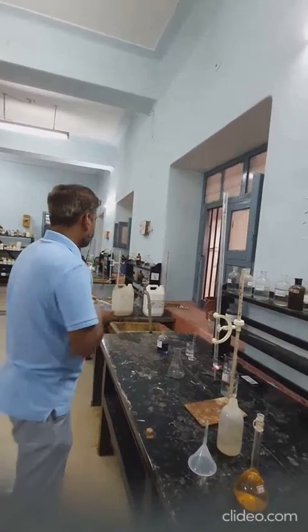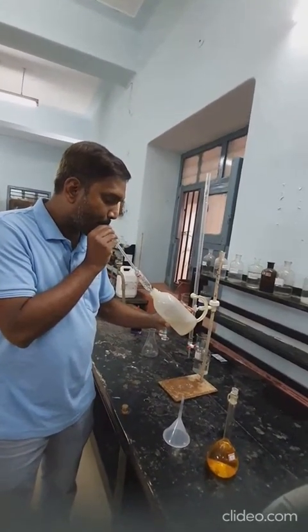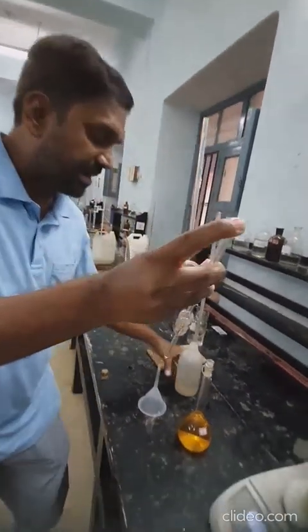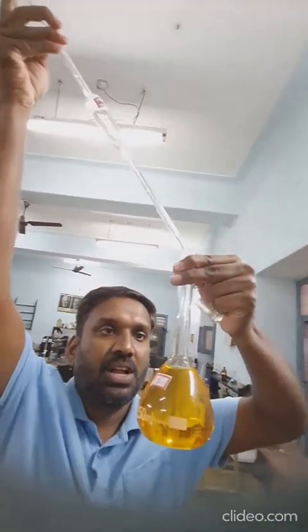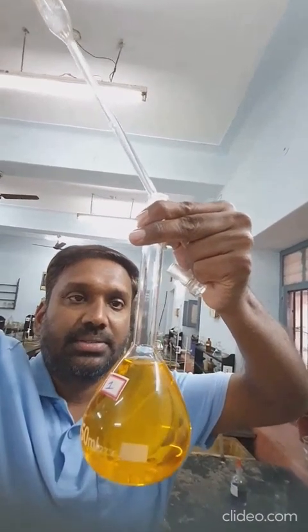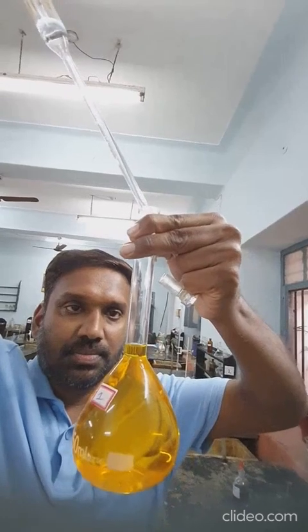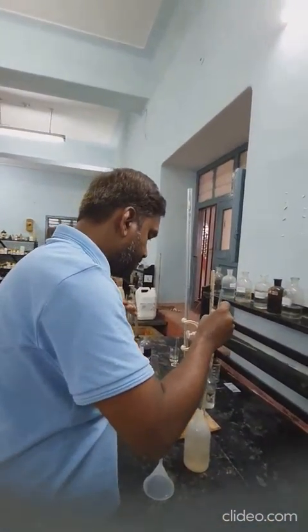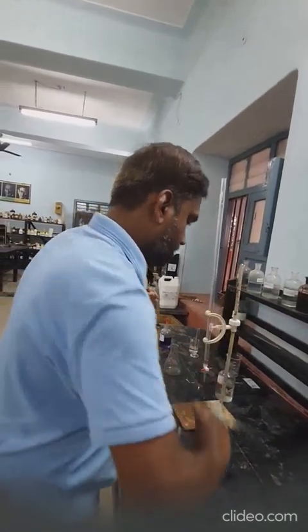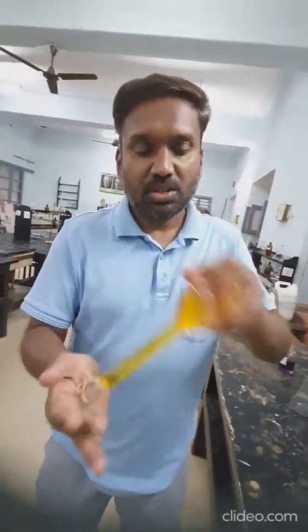Now, how to fill the remaining volume? That has to be done very carefully, through a pipette. Use a 10 ml or 25 ml pipette for this. Take about half the volume inside the pipette, then take the flask up to your eye level. Slowly open the pipette so that the water gently comes down over the wall and then goes up to the mark. Once it comes up to the mark, stop the pipette. Your solution is ready, but it is not homogenous still. Stopper it again and then make it homogenous.